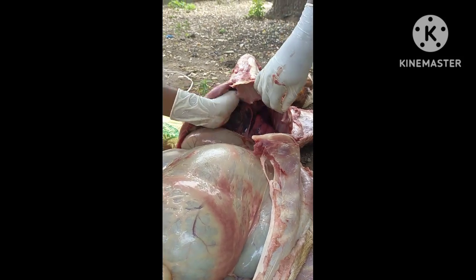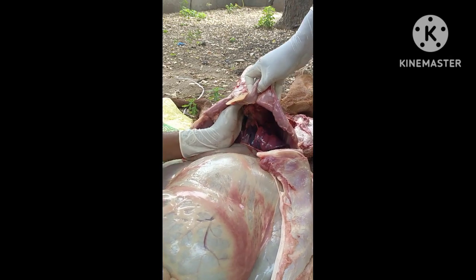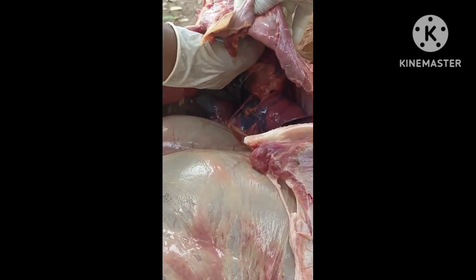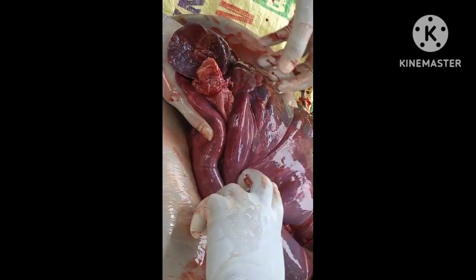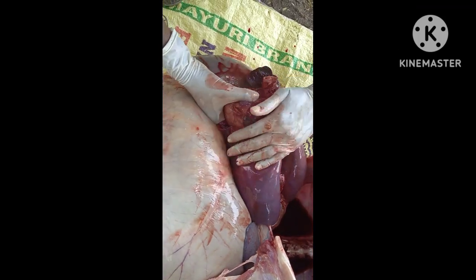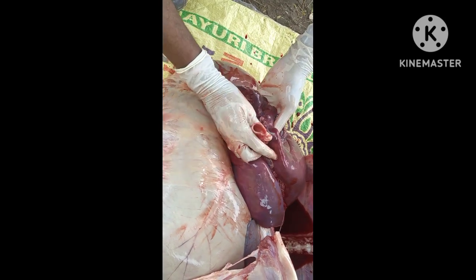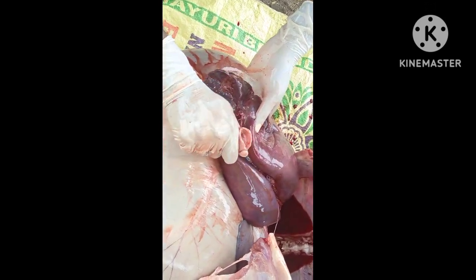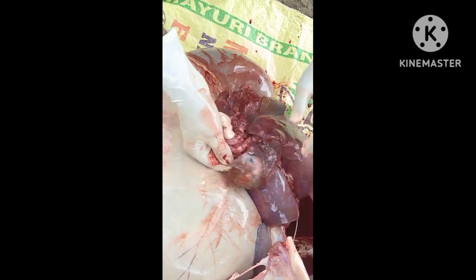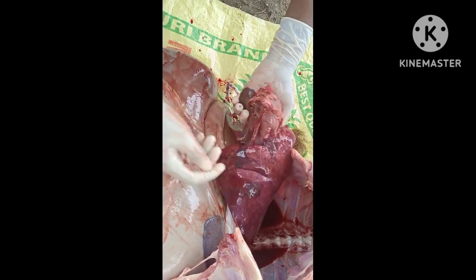If possible, break open the sternum, or if not possible, just hold the trachea with one hand and incise the trachea with a BP blade, and take out the contents of the thorax with hand pressure by holding the trachea. Observe the trachea by pressing it, and observe the contents of the trachea to see if there is any froth, and also observe the lung condition and the heart condition.